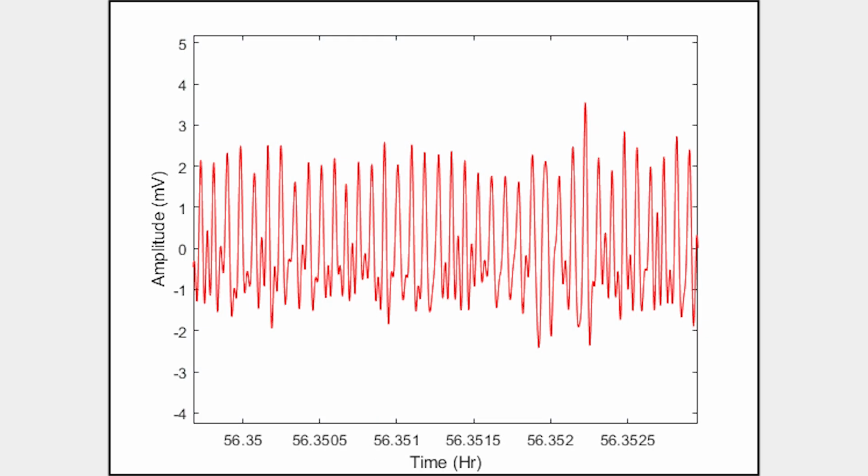If we zoom in on the time waveform from this region, a clear breathing pattern can be seen, with some impact of noise showing up as a small ripple during the negative excursion of the signal. For the features extracted from this waveform, this noise will have little to no impact on the classification.